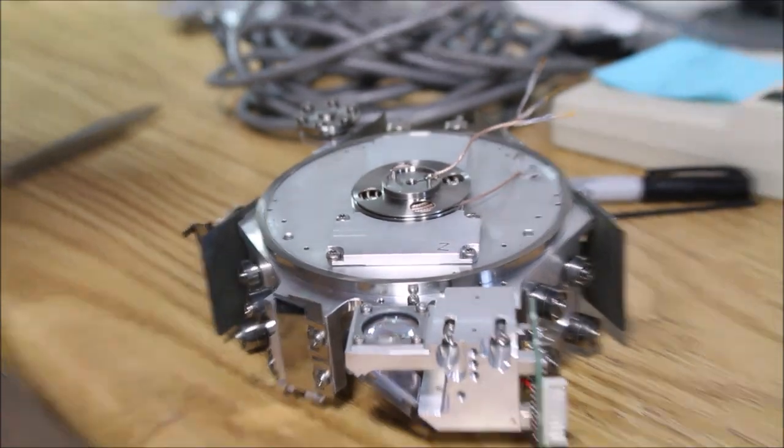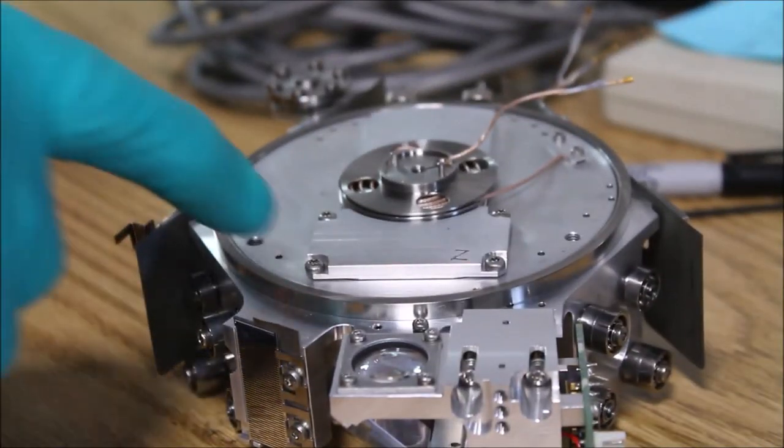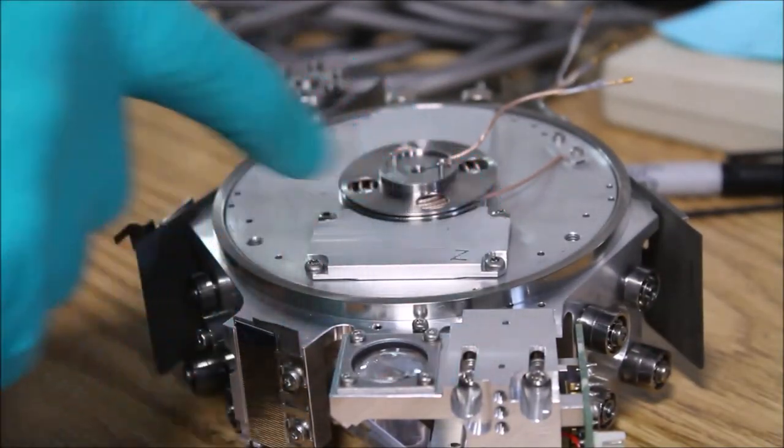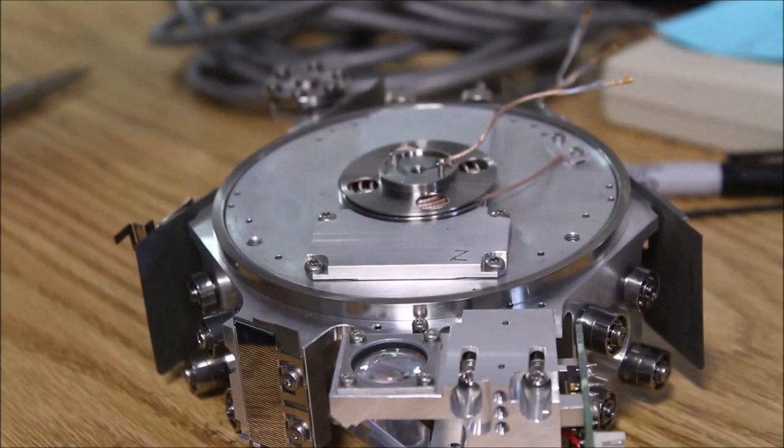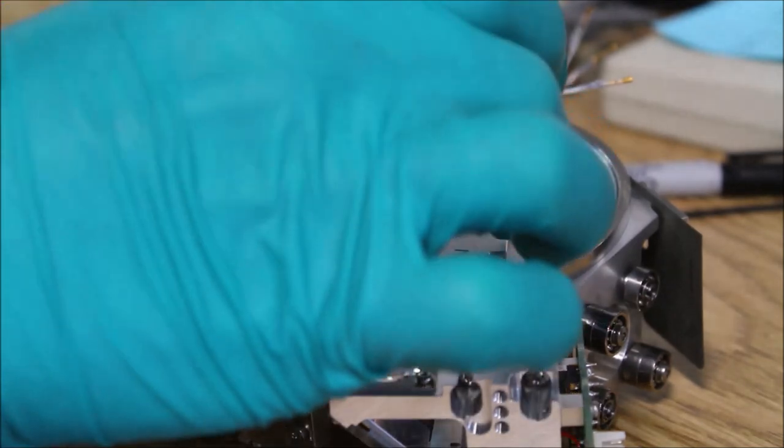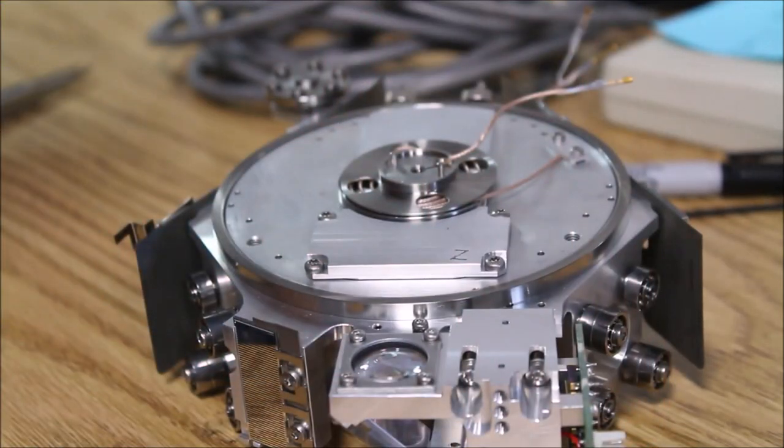Now this little plate, we can remove the four screws and that will access the little Z drive mechanism.